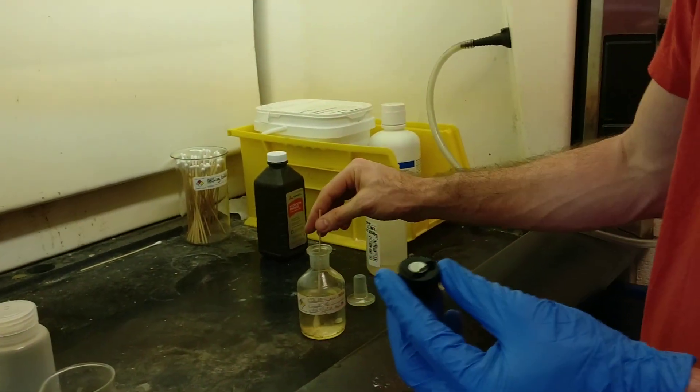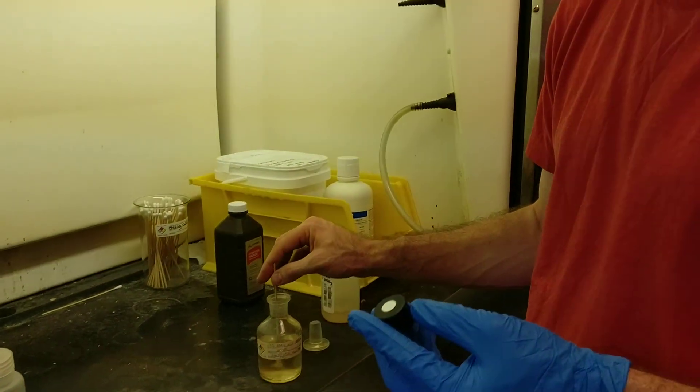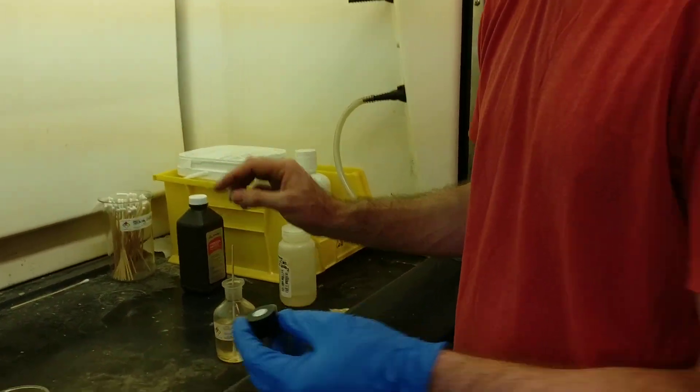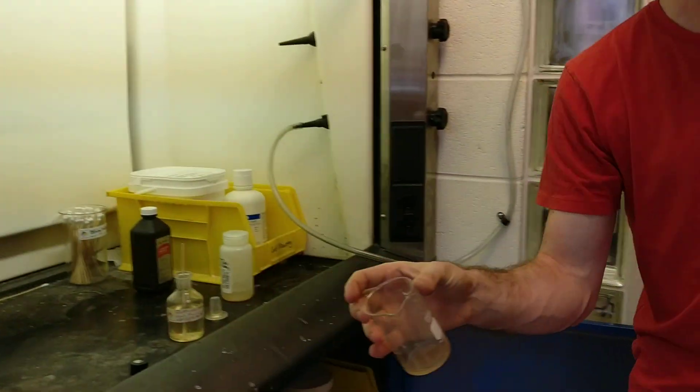So what we're looking for is a sample to go from a mirror finish to a cloudy finish, and then we're going to dunk it in a beaker of water.